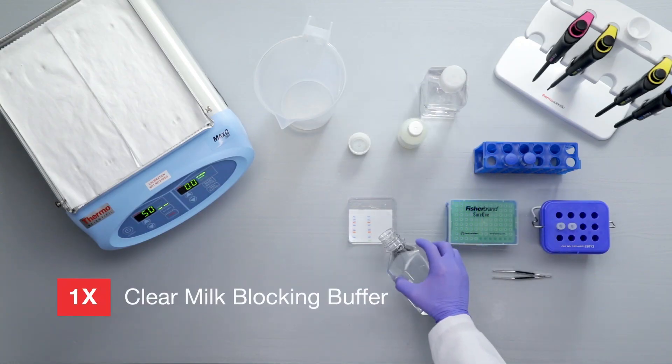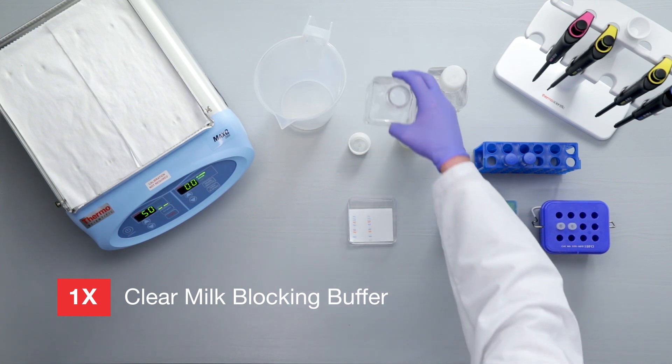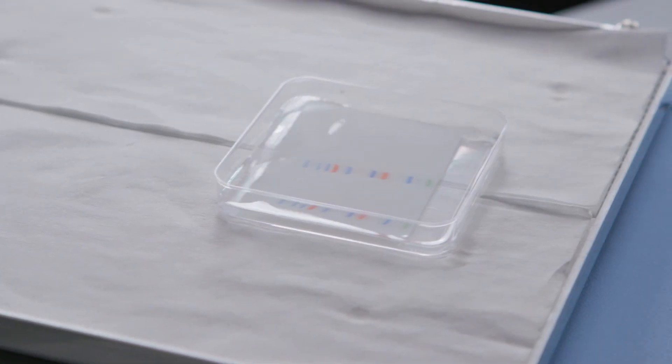To block your membrane, cover the membrane with blocking buffer and incubate for 30 to 60 minutes at room temperature with gentle agitation.